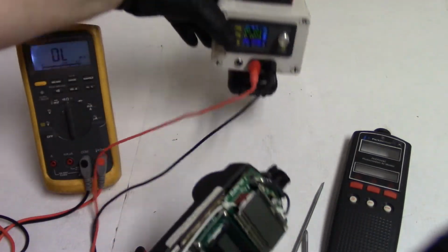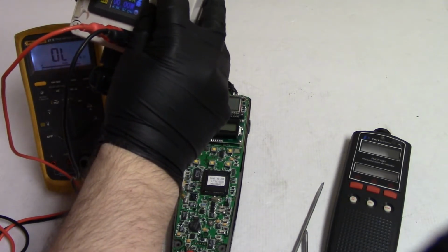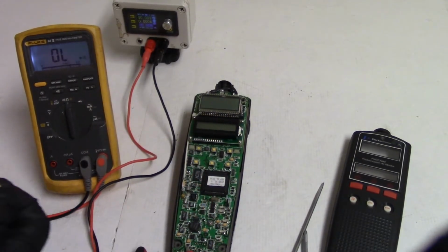Alright, let's just turn that off because it's a little annoying. I'm going to run it at 9 volts. I'm not really sure what the battery voltage was. I thought it was 7.2, but clearly it's not. Let's see if anhydrous isopropyl will trip this thing and make it pick some up. So I just soaked that swab there.